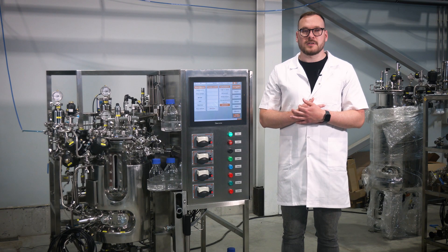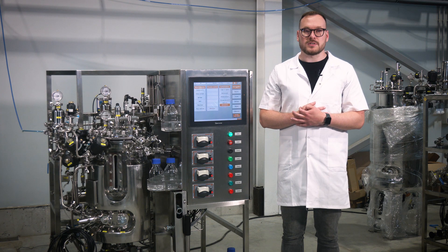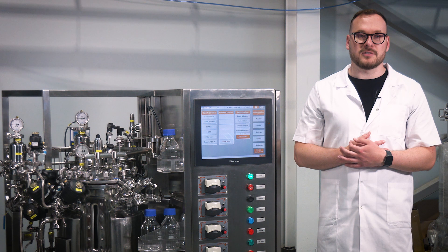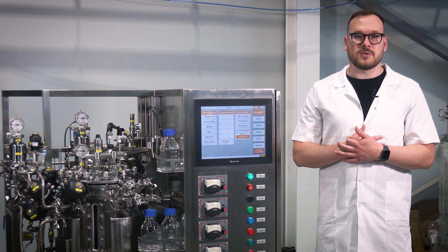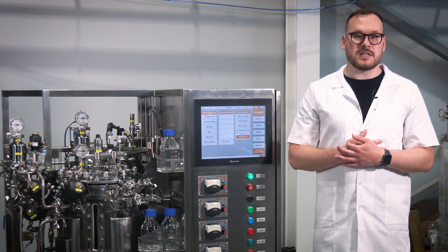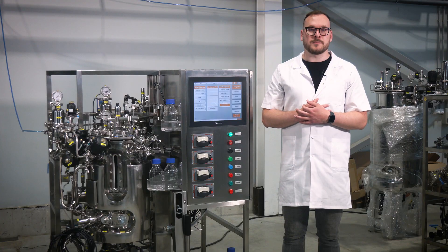The controller level grants the following options: All privileges of the operator access level, view the settings and calibration window. Manage automated process settings, perform pump and pressure sensor calibration.